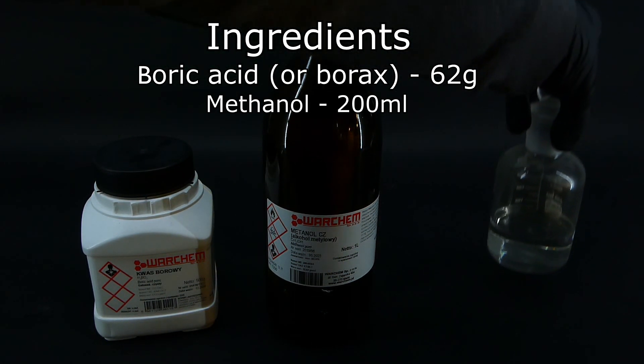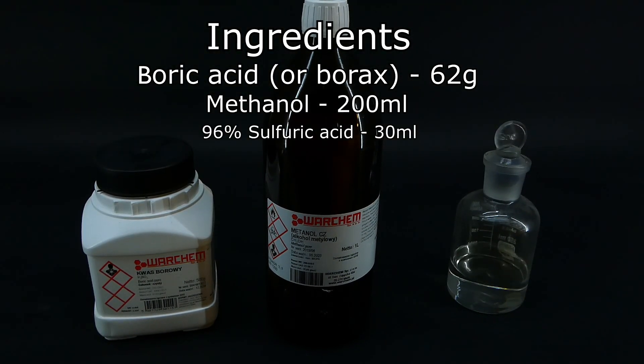The last ingredient is a dehydration agent. I use some 96% sulfuric acid, but other dehydrating agents such as phosphorus pentoxide could also be used.